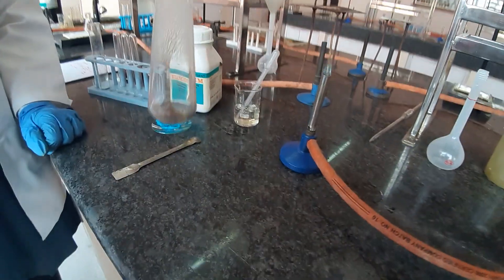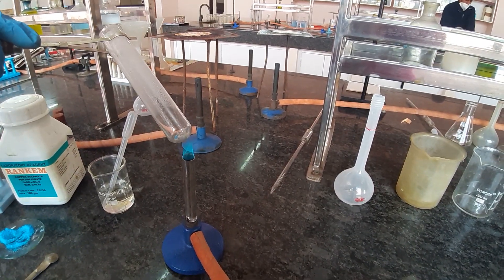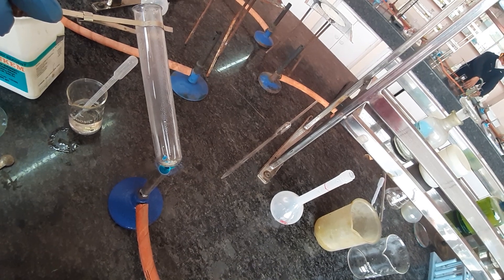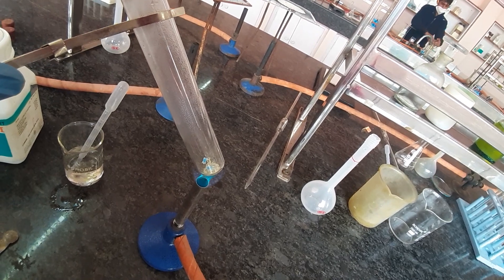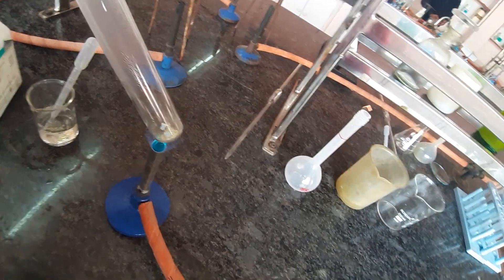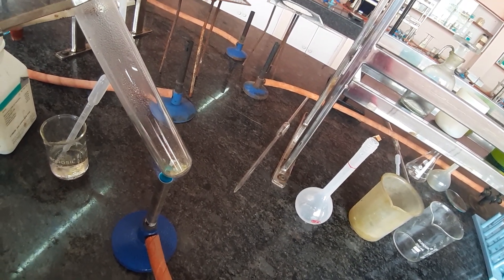This is turning to white. She will continue to heat so that the total amount of water gets removed. You can see the inner side of the test tube turning white because the copper sulfate is losing its water molecules. A little amount of blue is left, and it is totally turning into white solid because the loss of water molecules makes it absolutely white, while the water escapes as vapors through the upper end of the tube.